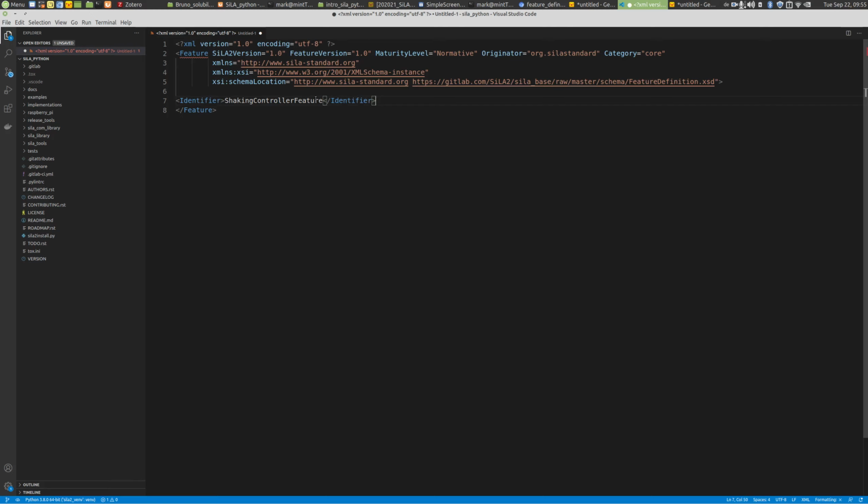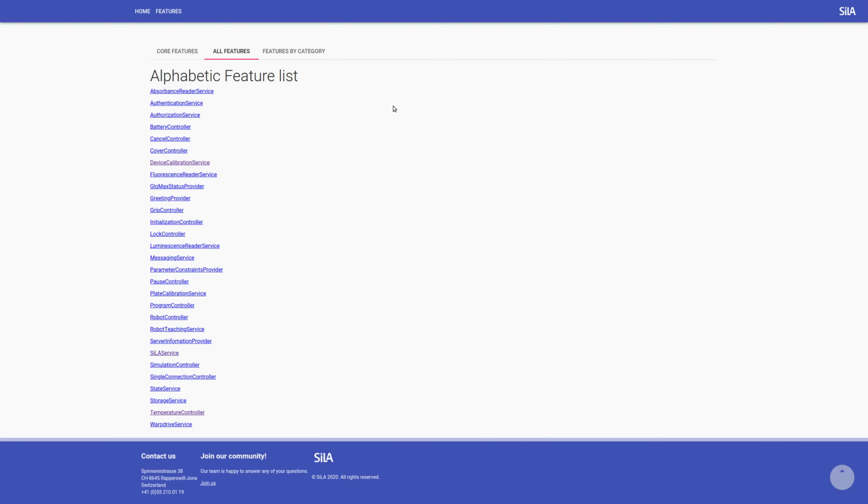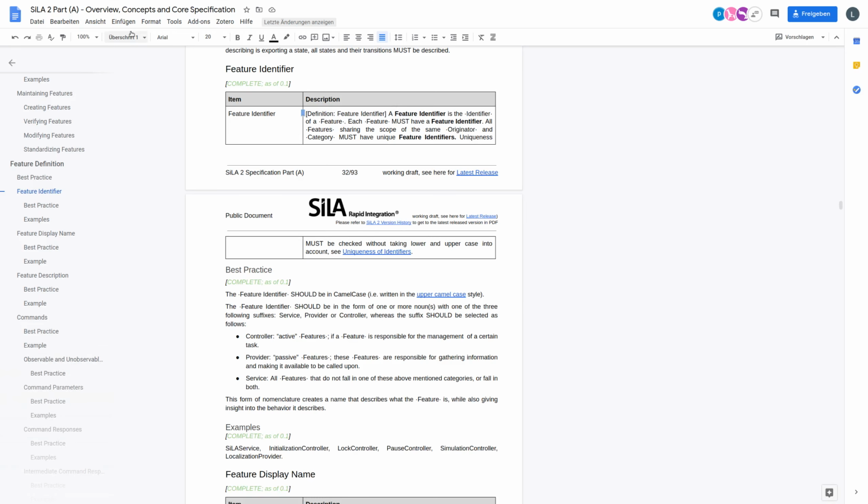By the way, before designing a feature, you should have a look at the specifications of features in SiLA Part A of the SiLA specification. If you go down here to feature definitions and then best practices or feature identifiers, you see there are recommendations on how you should name your features, how you should write them, how you should describe them. So before starting to really define a new feature, please read all about feature definition in Part A of the SiLA specifications.